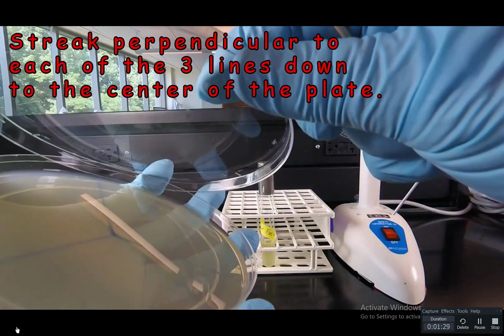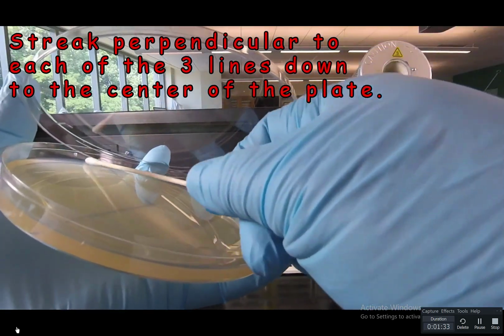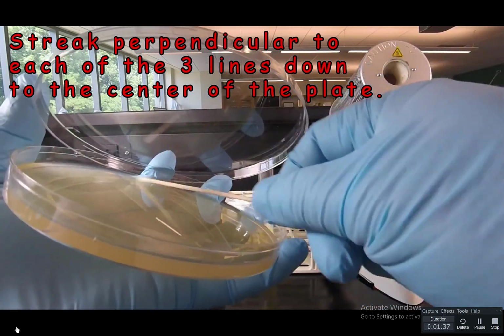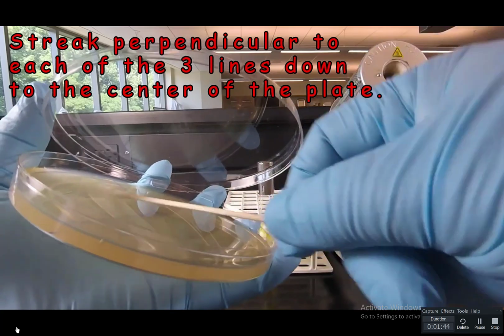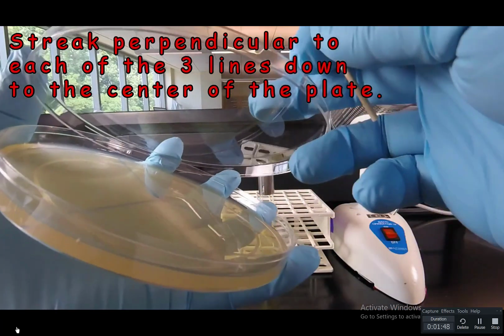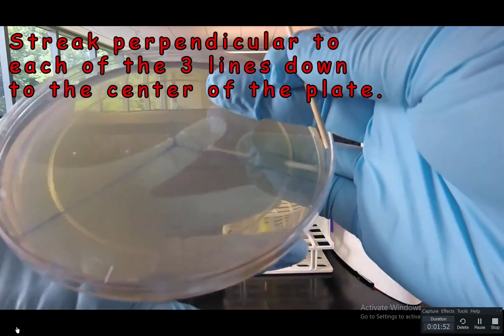So we lift the lid, and we're going to go perpendicular to this line. Notice I'm going all the way to the edge of the plate, and I'm overlapping the lines till I hit the center of the plate. Now we're going to rotate the plate and streak perpendicular to this line.